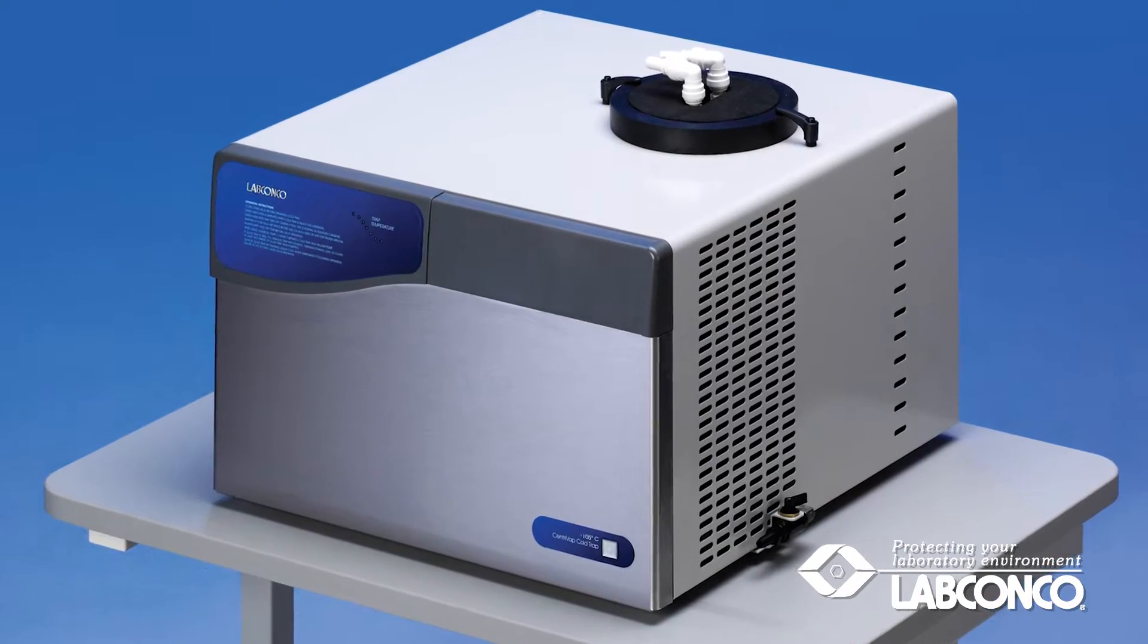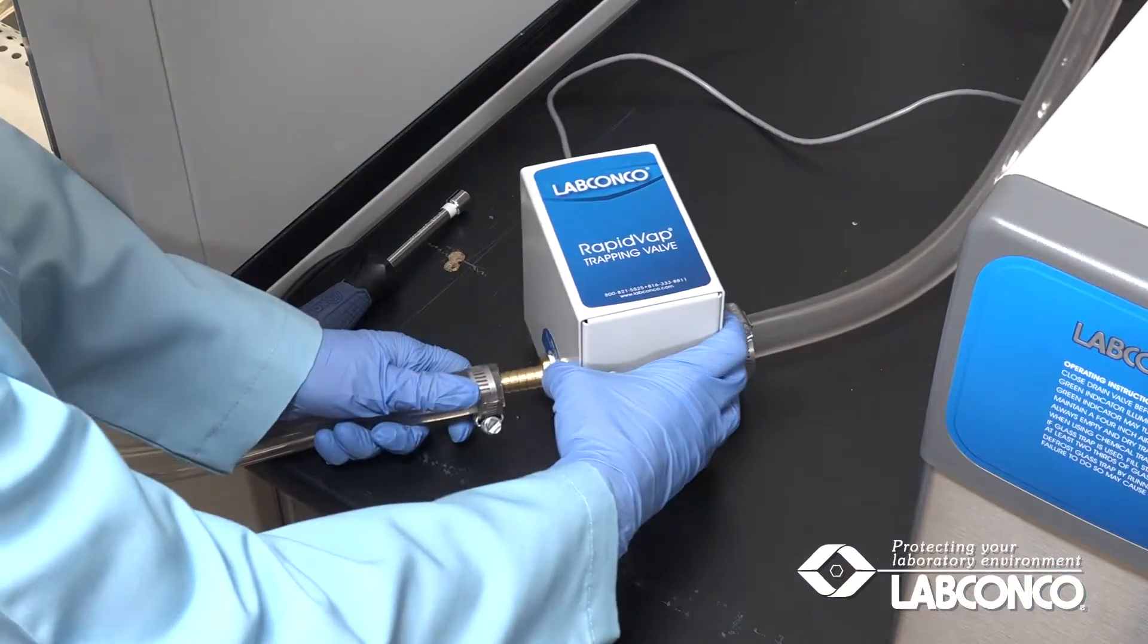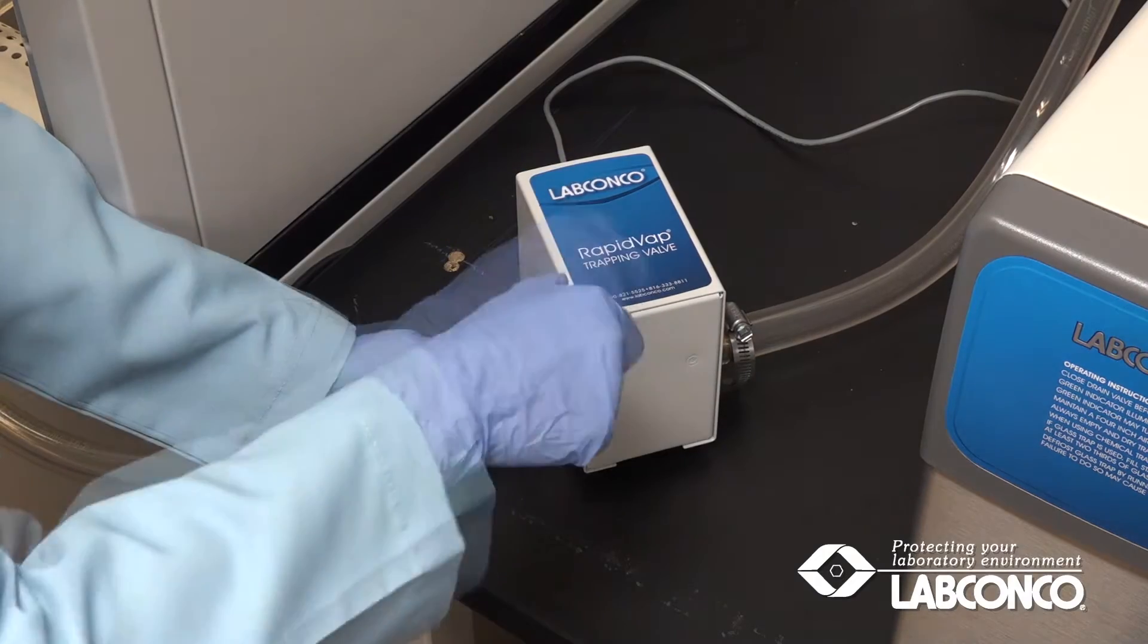If solvent recovery is required, a cold trap and trapping valve accessory can be installed in place of the liquid trap.